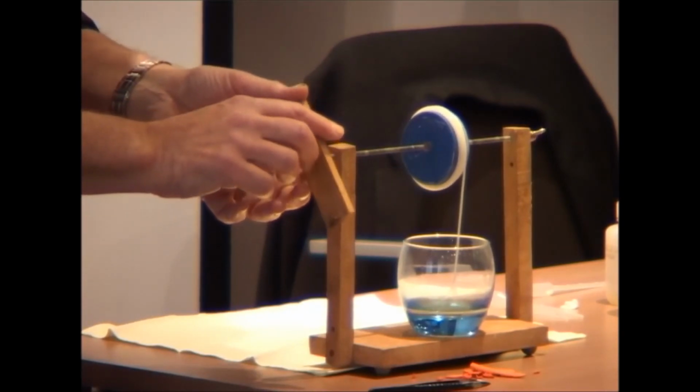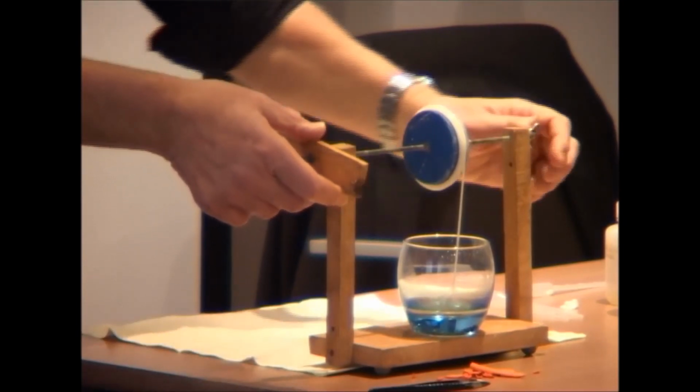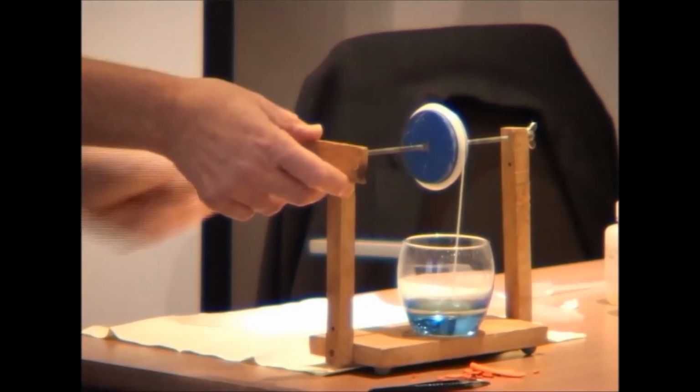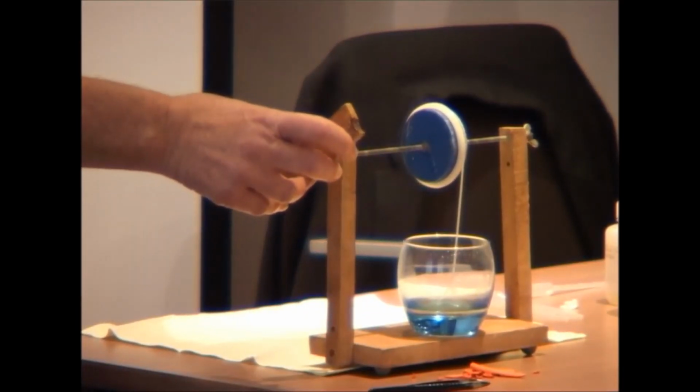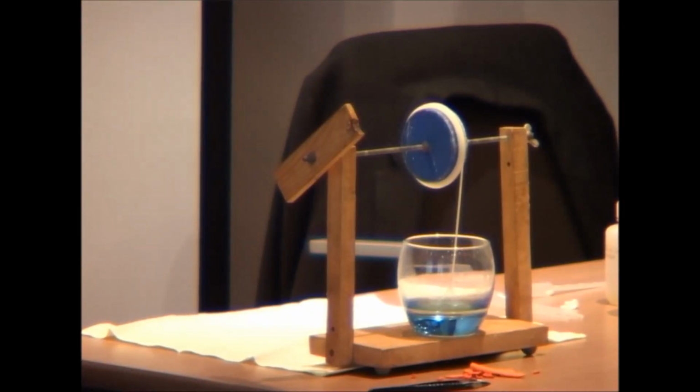Nylon 610 is not very flexible, and I think I've tightened this thing up so that I can't change it anymore. Anyway, we could go on further. We can go on doing that actually until one or other of the reagents is consumed.